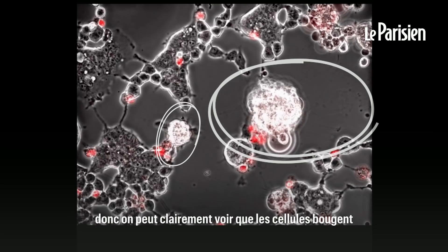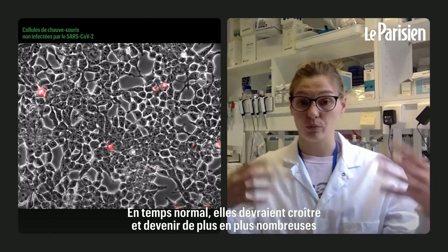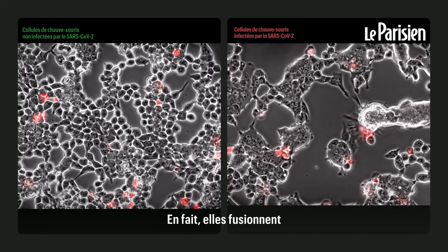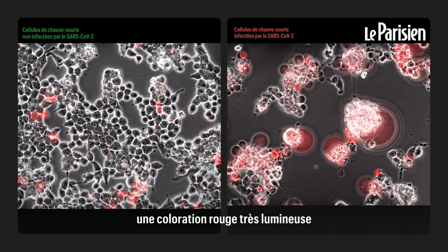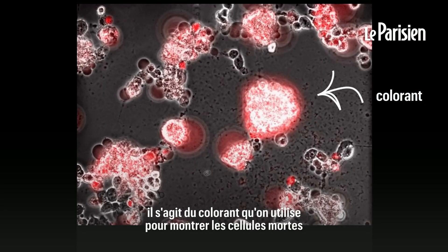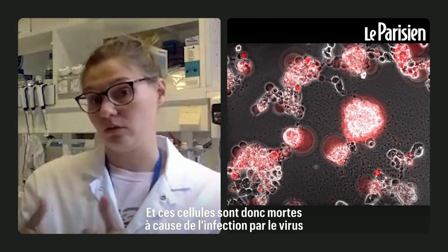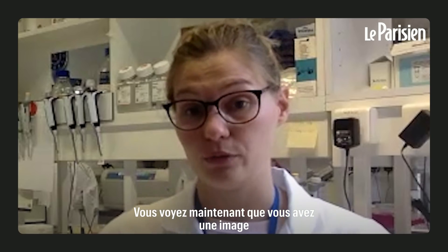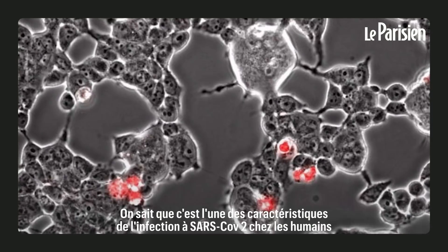You can pretty clearly see that the cells move. Normally they should grow and become more and more, but very soon they start to move towards each other — they actually fuse with each other. And at the very end, you see a very bright red stain, which is a molecular dye used to show cell death. Those cells died because of the virus infection. So you have a picture of two scientific events which are SARS-CoV-2 specific: cell fusion and cell death.